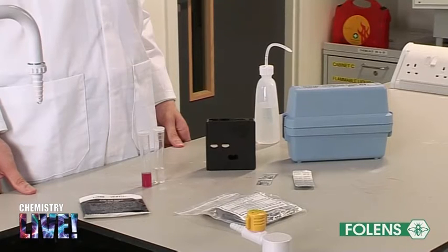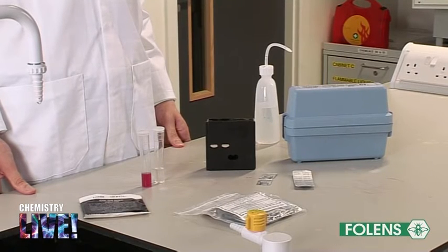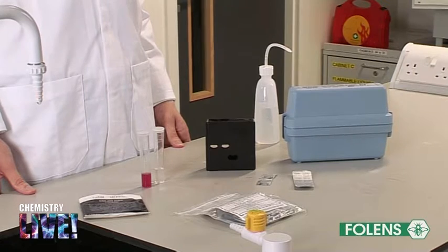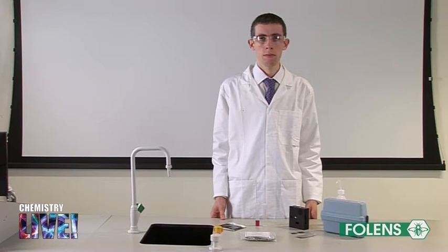In this experiment we will measure the amount of free chlorine in swimming pool water. There are two ways of measuring the amount of free chlorine.